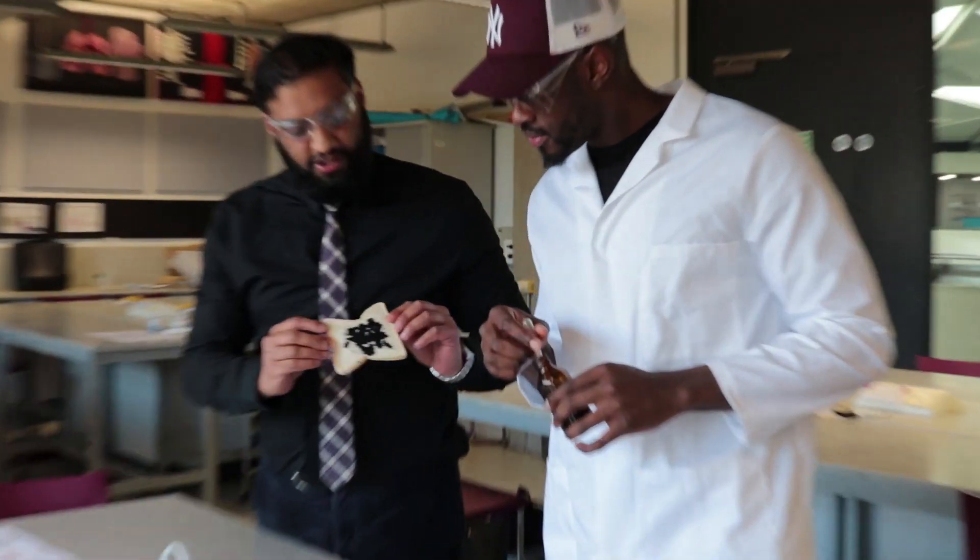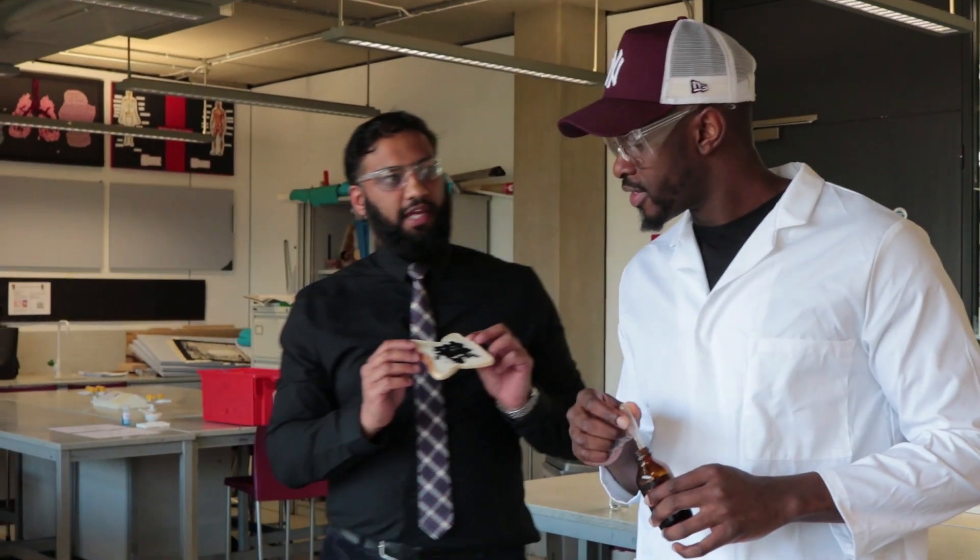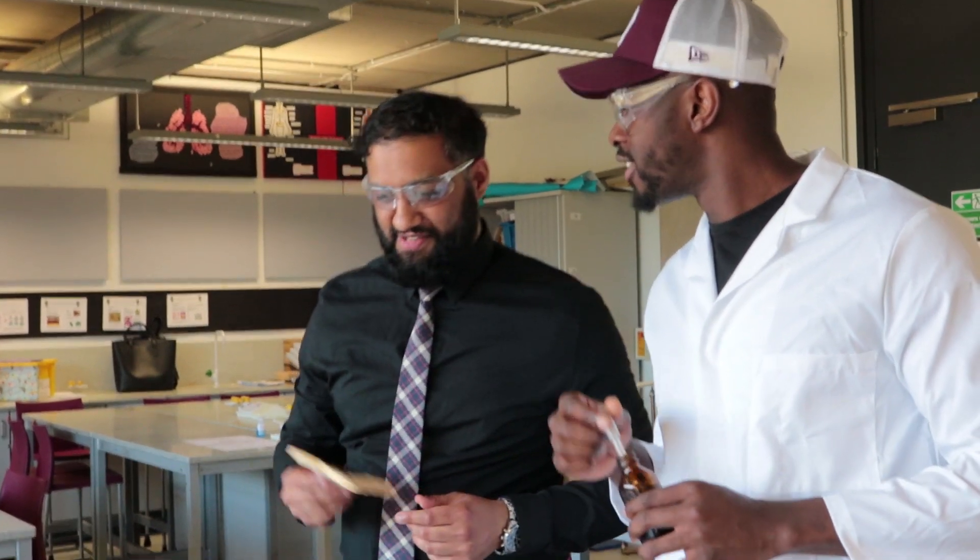It's like the dark blue-black, isn't it? What's that suggesting? There must be starch in there. Yeah, I think so. Brilliant. That's it - done. Testing for starch.